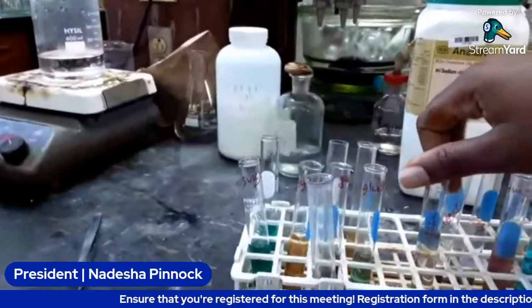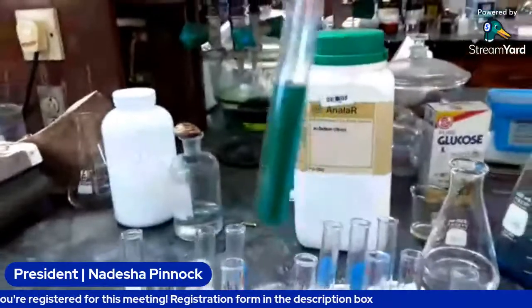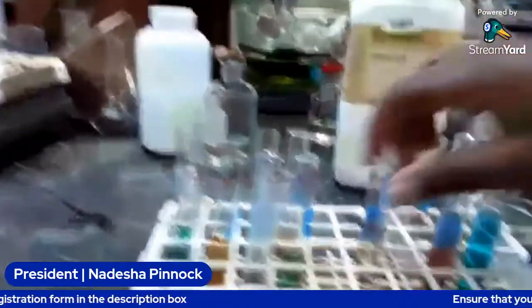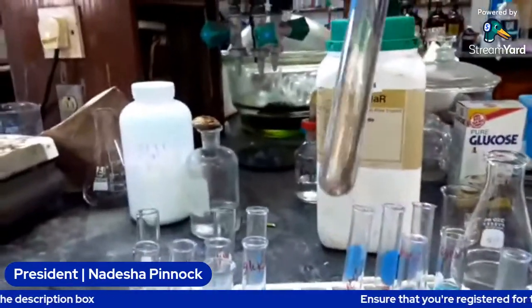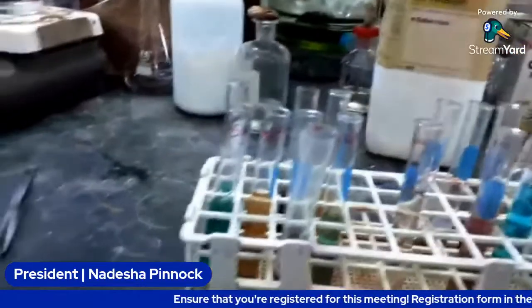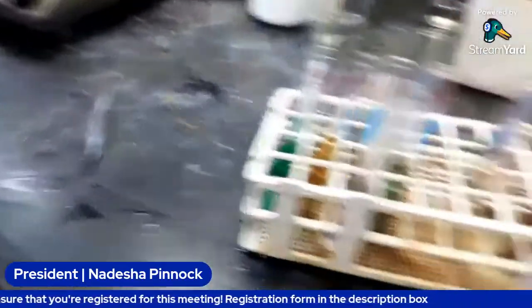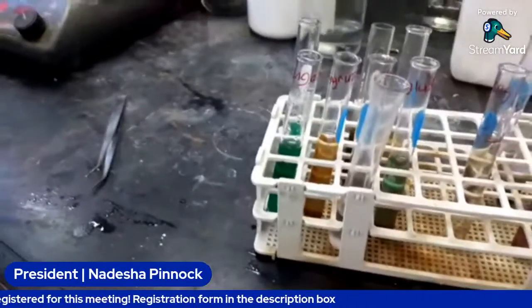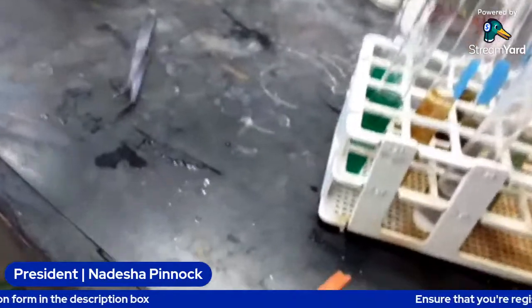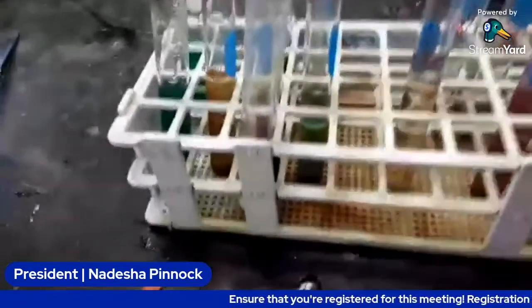So with this sugar, which one was the sugar again? This was the sugar that we initially had. It was blue-green. And this is what we have now that we added acid, and we get a precipitate. So that means the acid hydrolyzes the glycosidic bonds in the sucrose to reform the alpha glucose and beta fructose that makes up sucrose. And that's the end of the experiment.